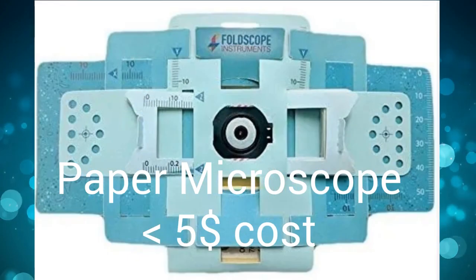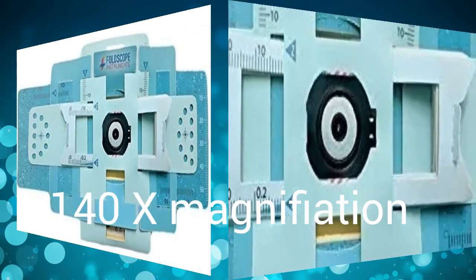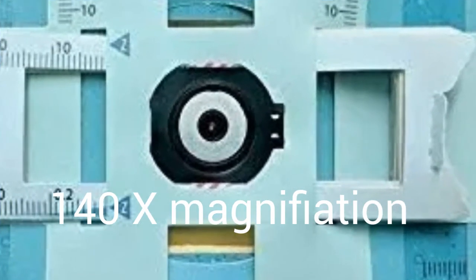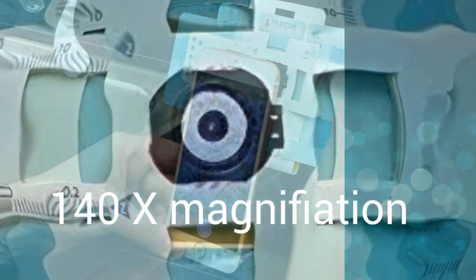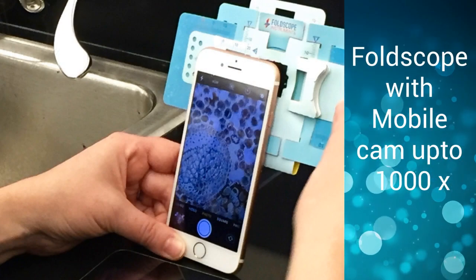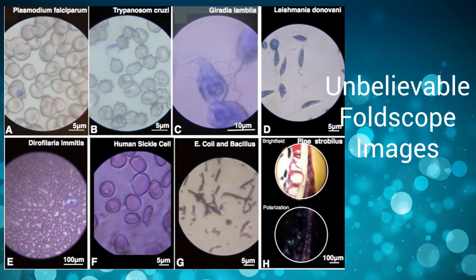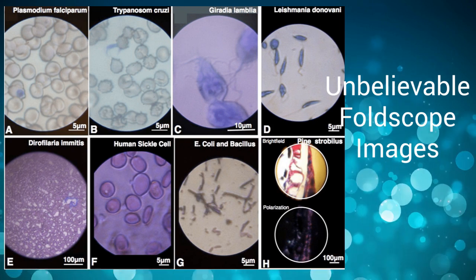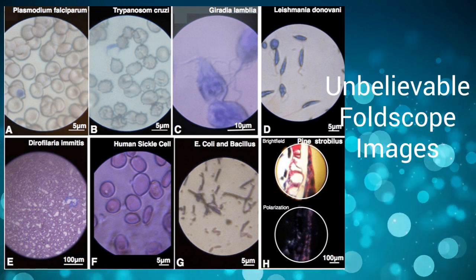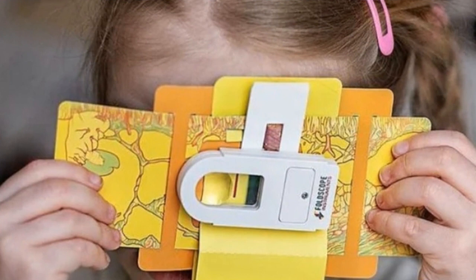You can get a simple microscope called foldscope that has a single lens having 140 times magnification. When used with the zoom lens of a mobile phone, it can give magnifications up to 1000 times. You can see larger microbes under this microscope, including fungi, protozoa, and some bacteria. This is good for children who want to experiment with the microbes around them.